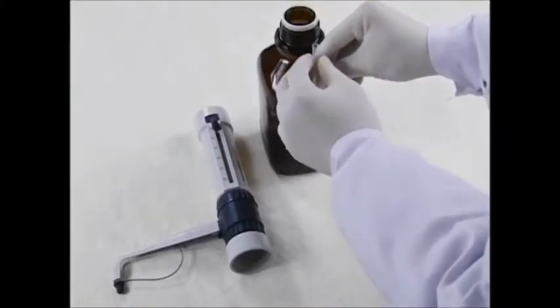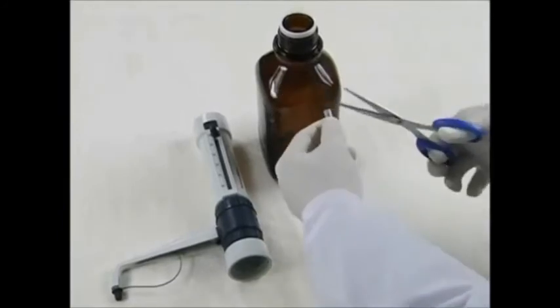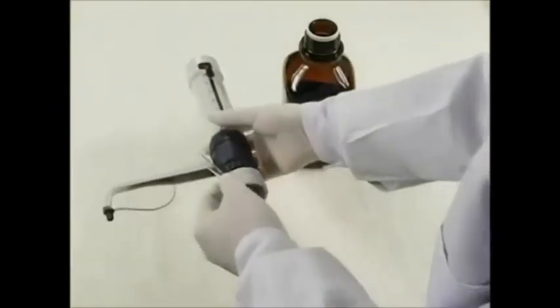Cut the filling tube at a diagonal angle to a suitable length for the bottle. Push the filling tube onto the inlet valve as far as possible.